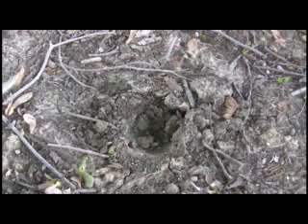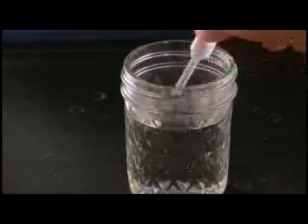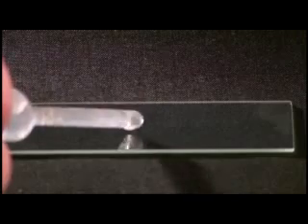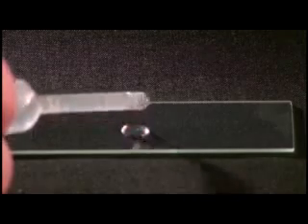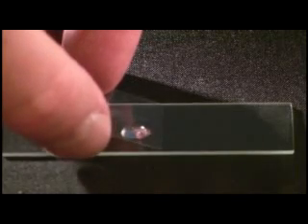Part B. If you have access to some soil, either from your yard, a nearby park or construction site, or from a store, collect some of that soil in a Ziploc bag. Take your samples home. Put some water in the soil. Use a pipette, eyedropper, or straw to pick up some of the water and place a drop onto the microscope slide. Repeat the same procedure with the microscope as in Part A.